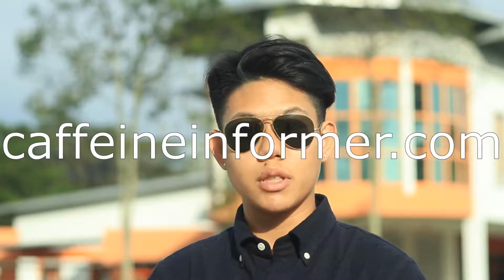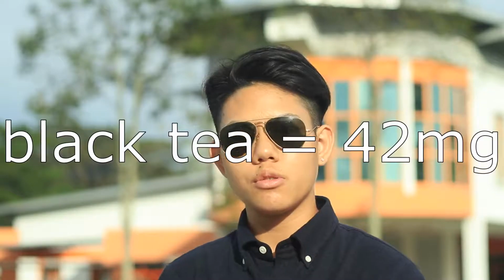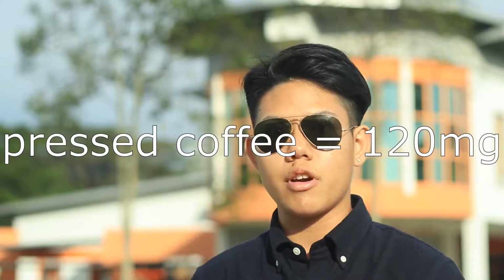According to caffeineinformer.com, we get the concentrations of caffeine in each of the sources of sample used in this experiment: instant coffee with 57 mg, black tea with 42 mg, green tea with 25 mg, decaffeinated coffee with 5.6 mg, and pressed coffee with 120 mg. All these values are based on an 8-ounce cup size. Thus, further conversion is done by us.